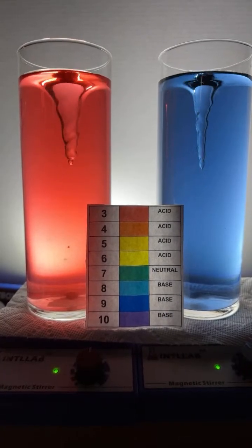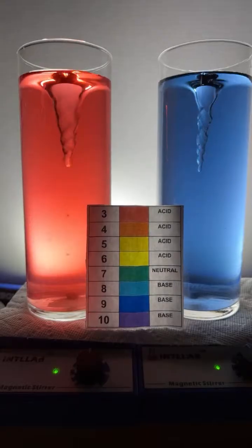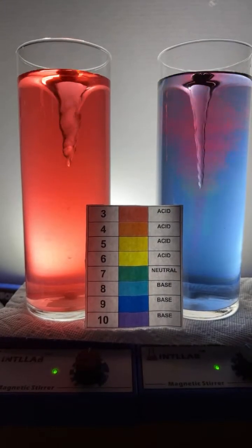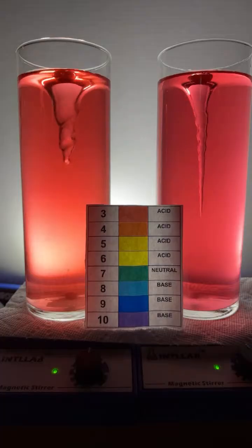It is a little weird that Coke has such a low pH. Whenever you mix the base or acid in a universal indicator, what happens inside on a molecular scale? All right, Fidro asking the theoretical question. So you're all going to have to forgive me just for a bit here. Yeah, that's right. Coke is acidic due to the carbon dioxide that's added.